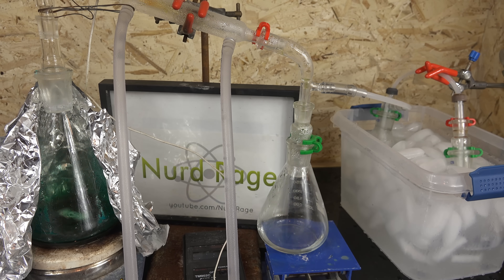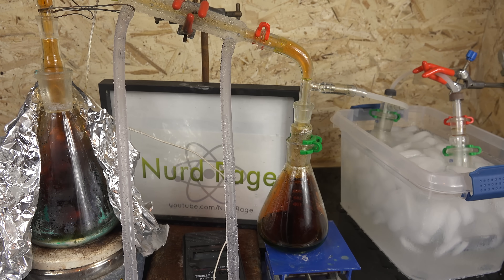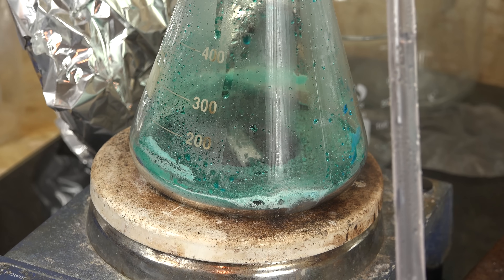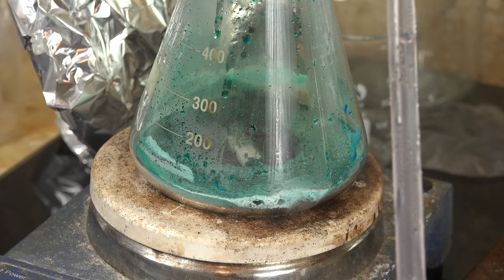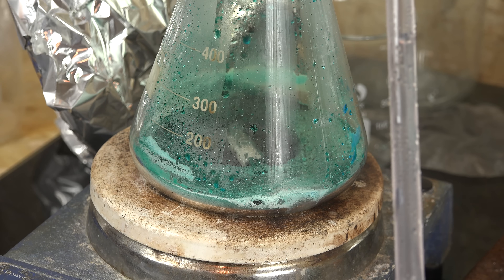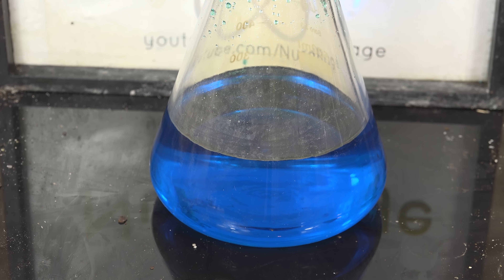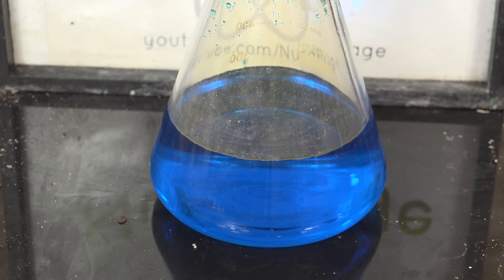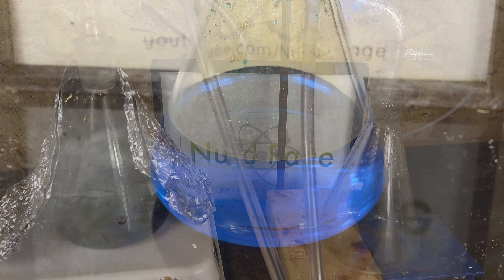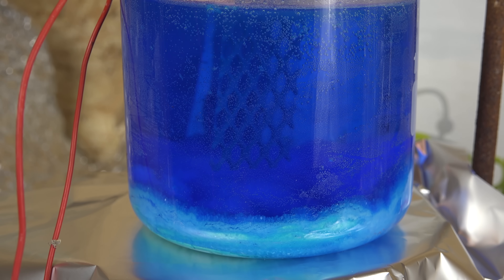Now I know a few of you have already decomposed your copper nitrate using the thermal decomposition method to get nitric acid and have already produced a fair amount of copper oxide waste. You might be wondering if you screwed up and can no longer recover the copper. Don't worry, you can still use the electrolytic process to do so. Just get your copper oxide residue and titrate in a 10% solution of sulfuric acid until it's completely dissolved. This will produce copper sulfate — you may need to boil it to drive the reaction forward. You can then proceed as normal and distill off the excess water and residual nitric acid and then perform the electrodeposition as shown in this video.